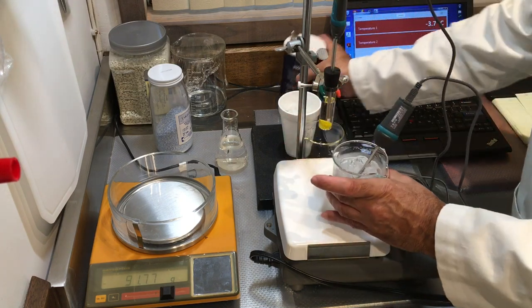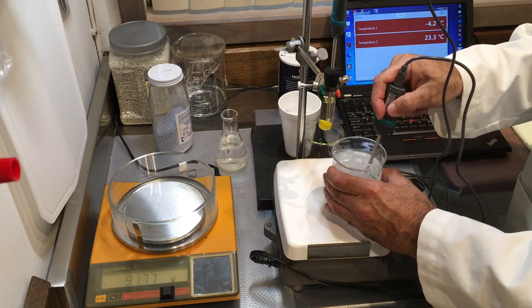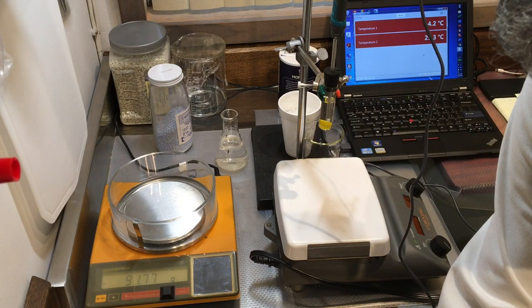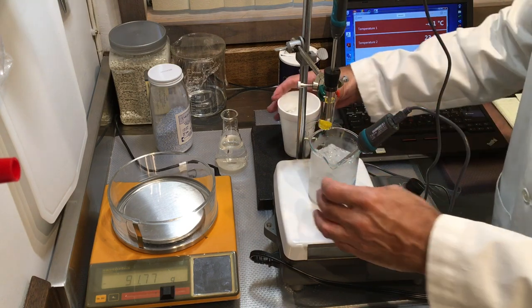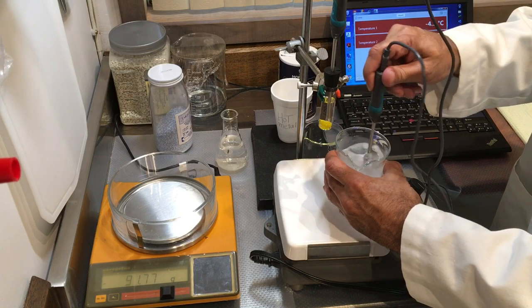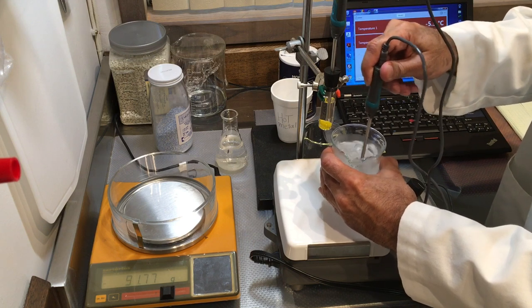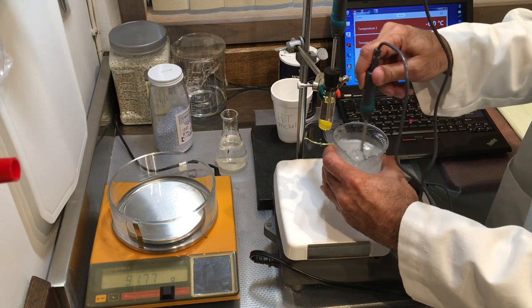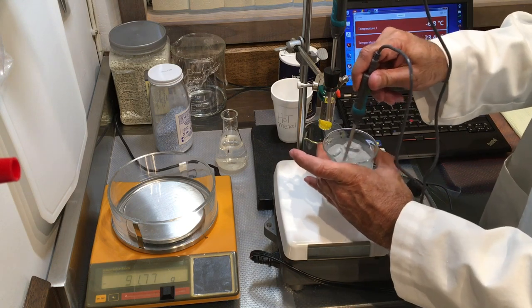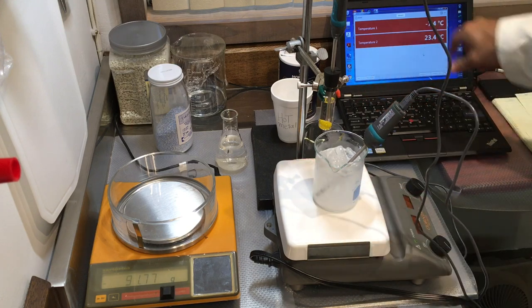I'll add a little bit more salt to bring it to lower temperatures. This process takes a lot of salt. I may need to empty out some water and add more ice. We now have negative 7 degrees Celsius in the bath.